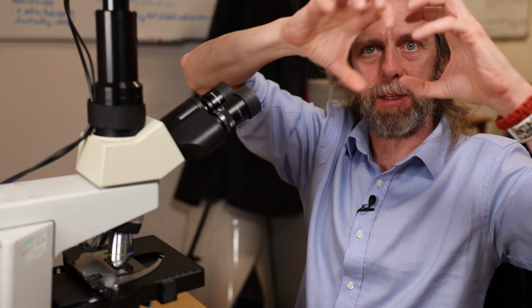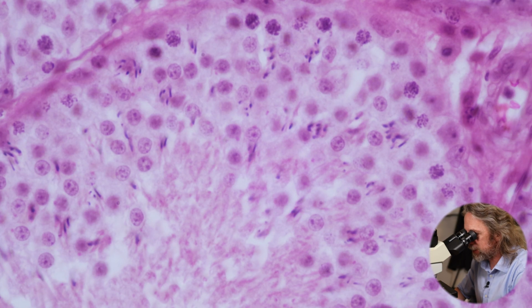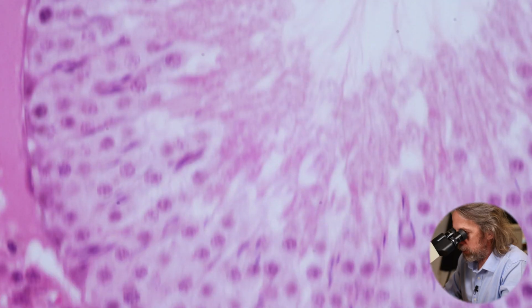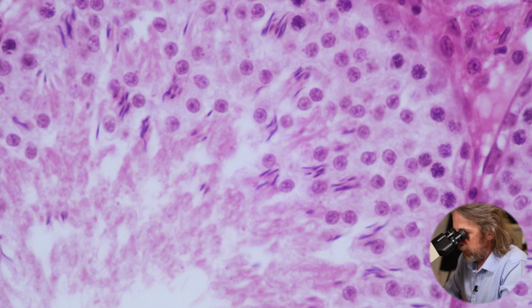So the DNA gets pulled to either side of the cell, each is a copy, and then the cell gets split down the middle and pop, you've got two new cells. So yeah, we can see cell division in action. Cool, huh? You see what I mean though? It doesn't look like any other tissue. It's cool to look at.